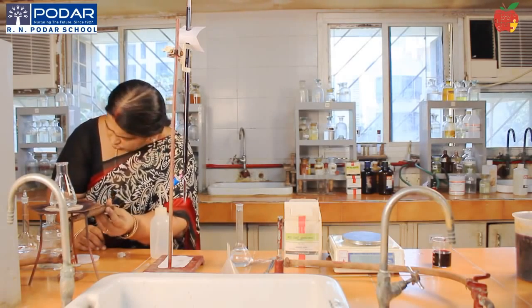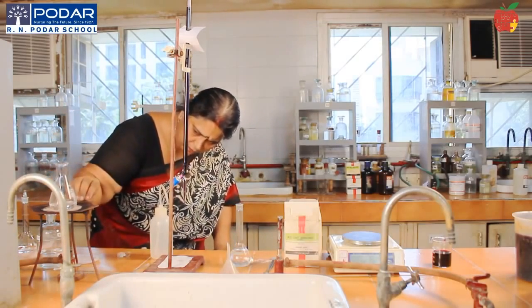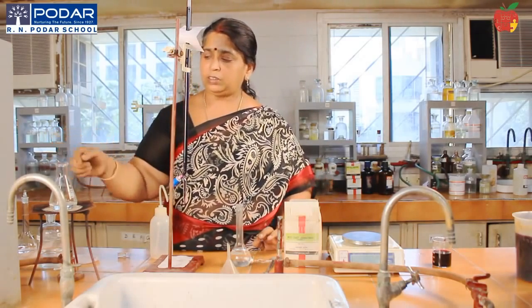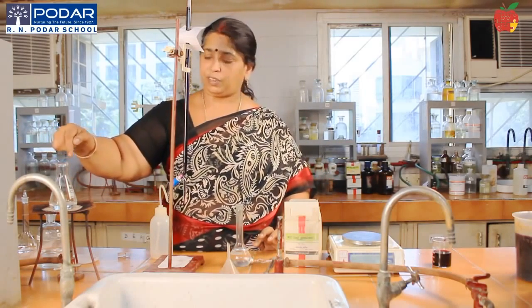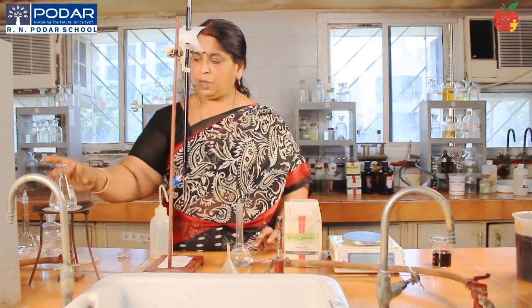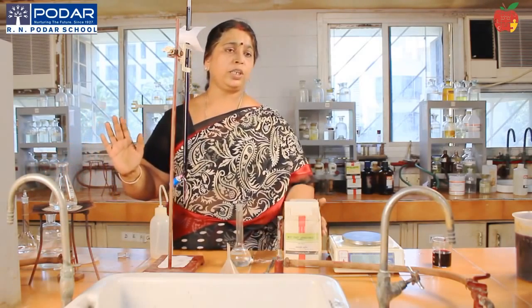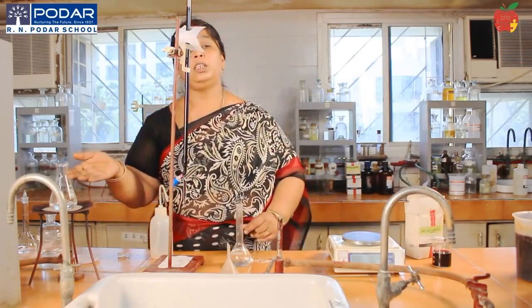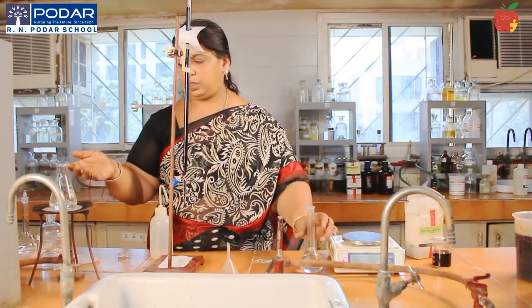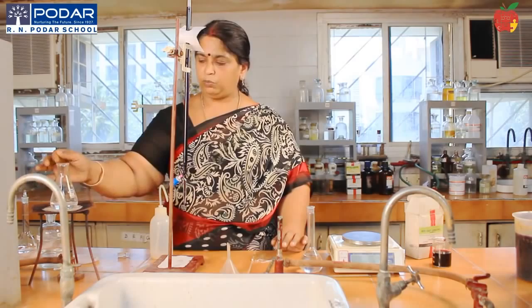Keep it for heating, and see that you don't have to heat it till boiling. Just heat it until there are some water droplets on the sides of the conical flask. That means 60 to 70 degrees centigrade, a bearable warmth, not too hot. Heat only to catalyze the reaction, just to make the reaction occur faster. You all know that the reaction occurs faster at a higher temperature. Also, some carbon dioxide will be evolved, so they dissolve also. Okay, so just heat it to bearable warmth.